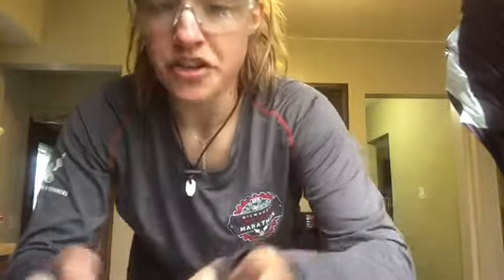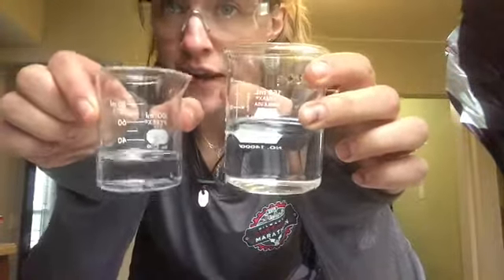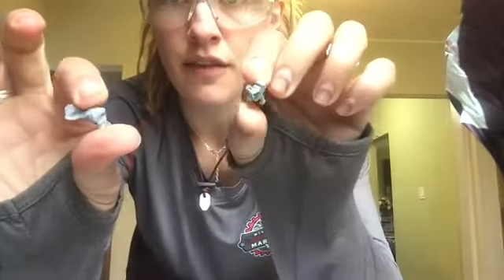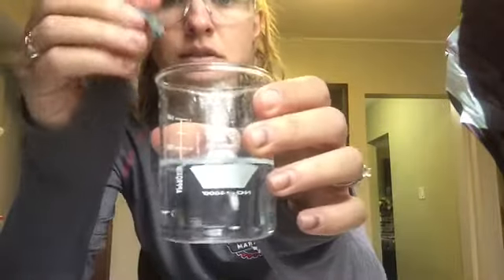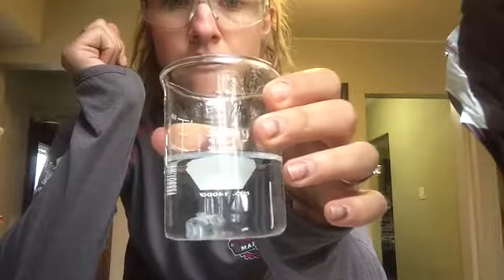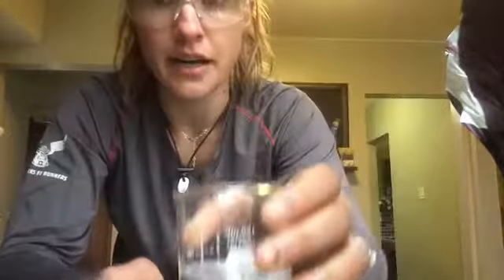So for the next part of the reaction, I have my diluted hydrochloric acid and my concentrated hydrochloric acid. So the concentrated is in the little container, and I also have some pieces of the metal zinc. So these little pieces of metal will react with the hydrochloric acid to give off hydrogen gas and create zinc chloride. This reaction is also exothermic, so it generates heat. So when we put this into the dilute solution, we can see some bubbles coming off of it, but not a ton.